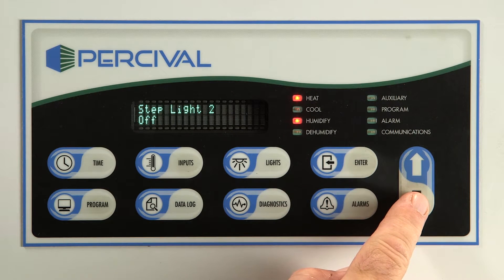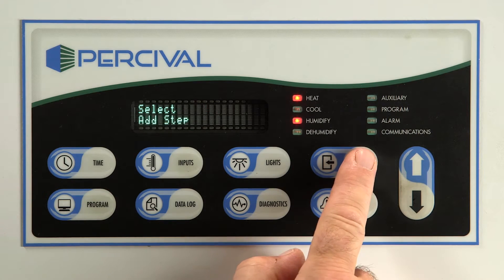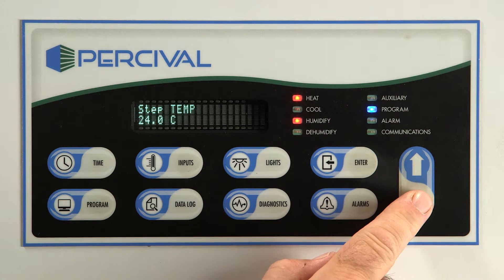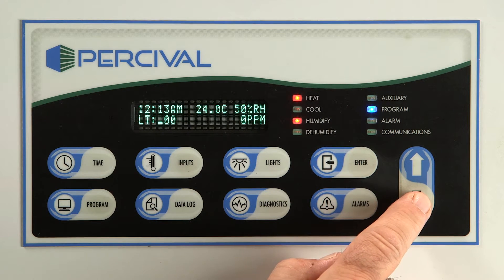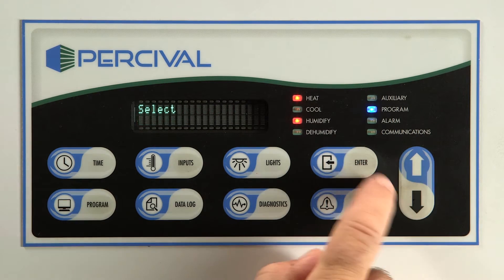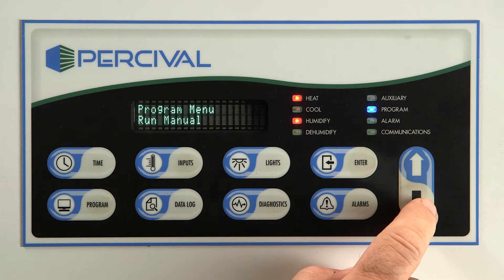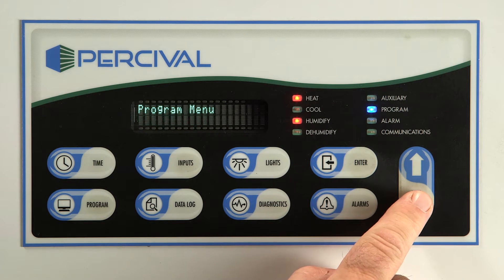To add the next step, press program key, select add step, and press enter as you did above. Again, it will display the settings for this step. Follow the instructions above to add steps. If you don't have any more steps to enter for this program, press program key and arrow up to quit. Using the same menu allows you to add, delete, or edit steps. After you select quit, arrow down to run program and select the program you wish to run.